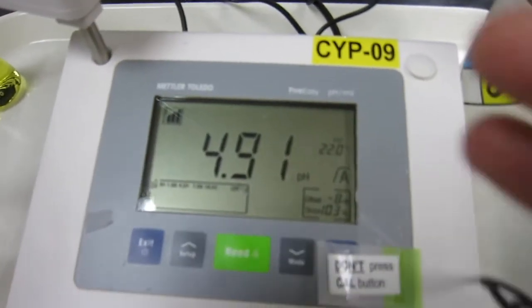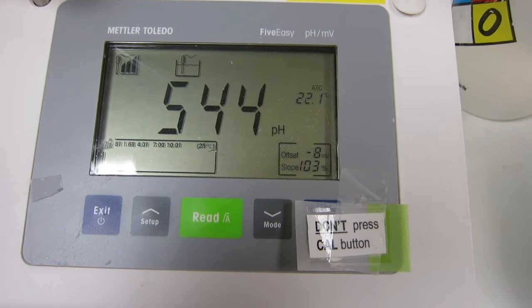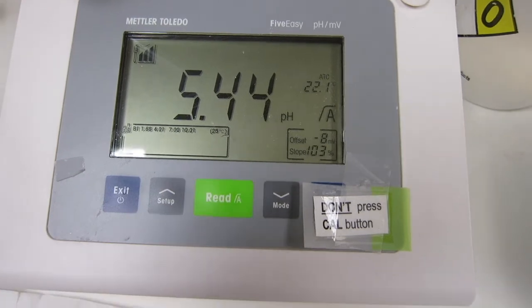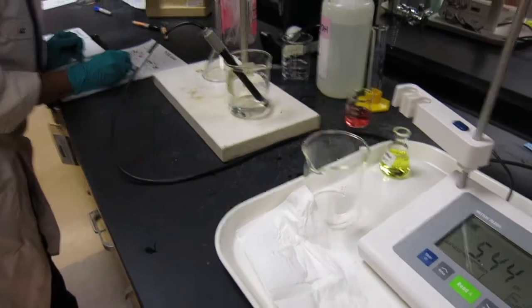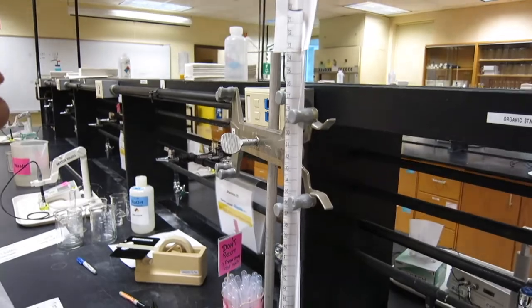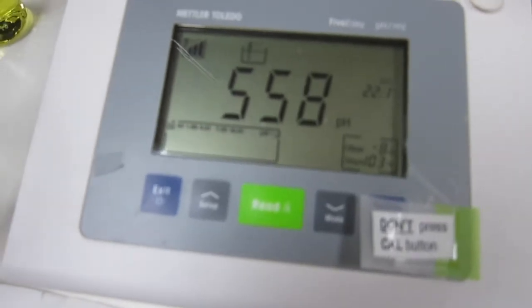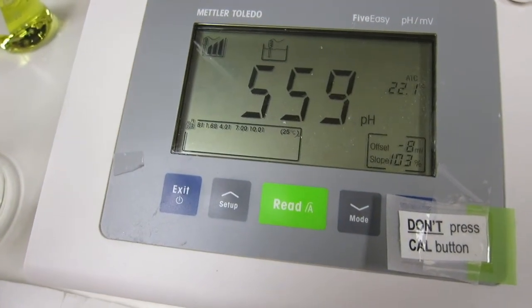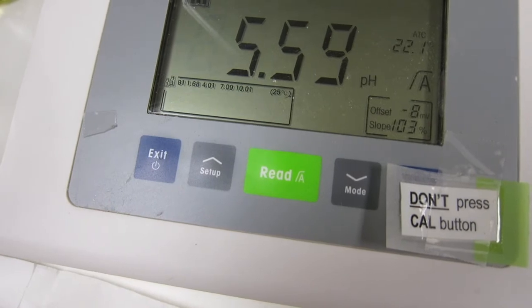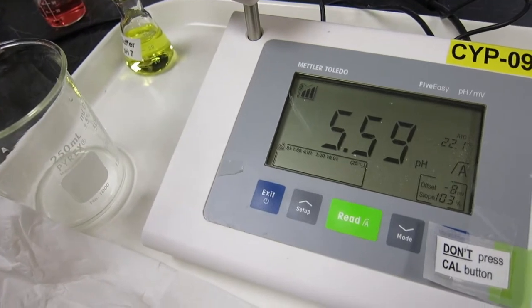Press read. Now we're switching to 1 mL at a time. The pH is 5.59 at 21 mL. Keep going — dispensing one more mL, now at 22 mL.